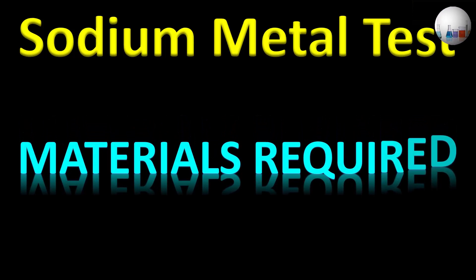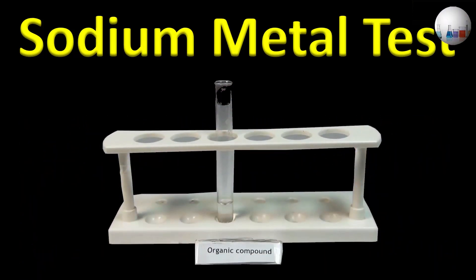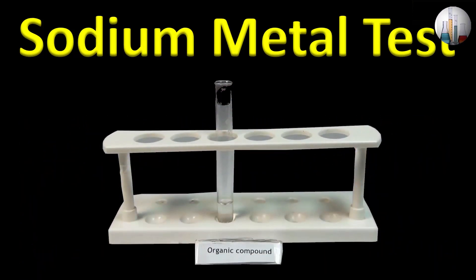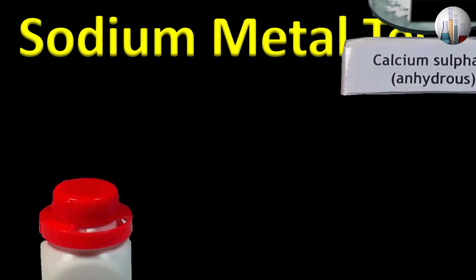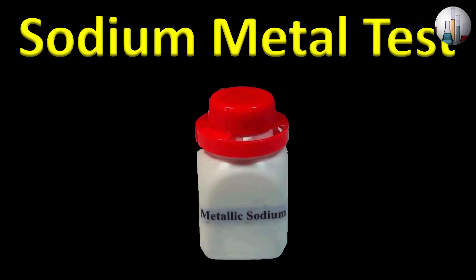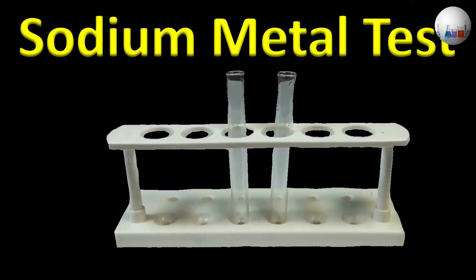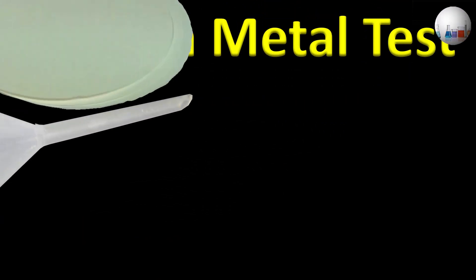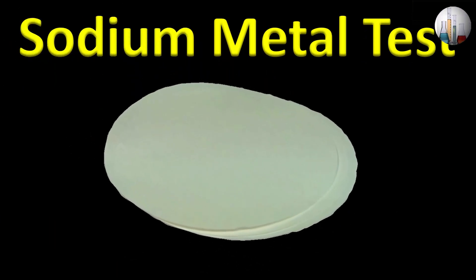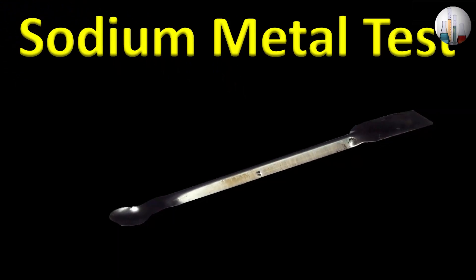Materials required: organic compound, anhydrous calcium sulphate, sodium metal, test tubes, funnel, filter papers, spatula, and forceps.